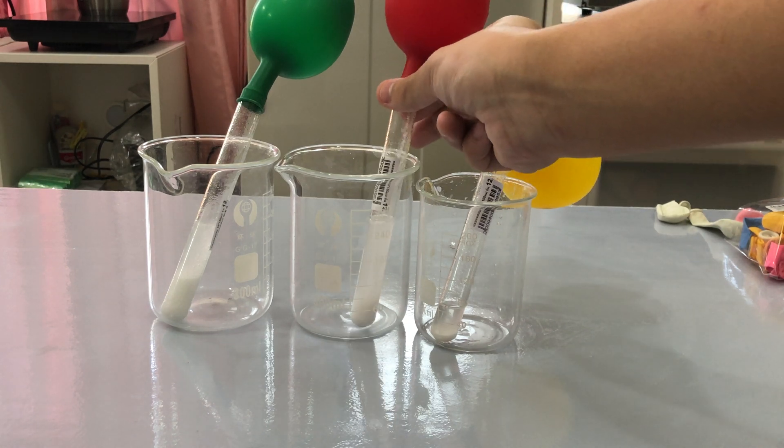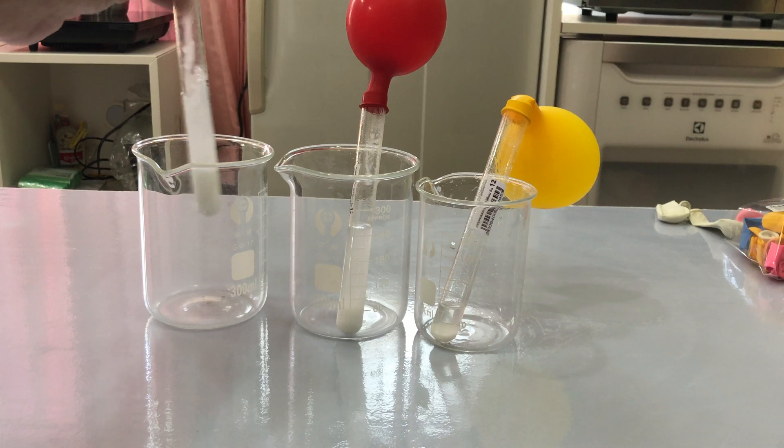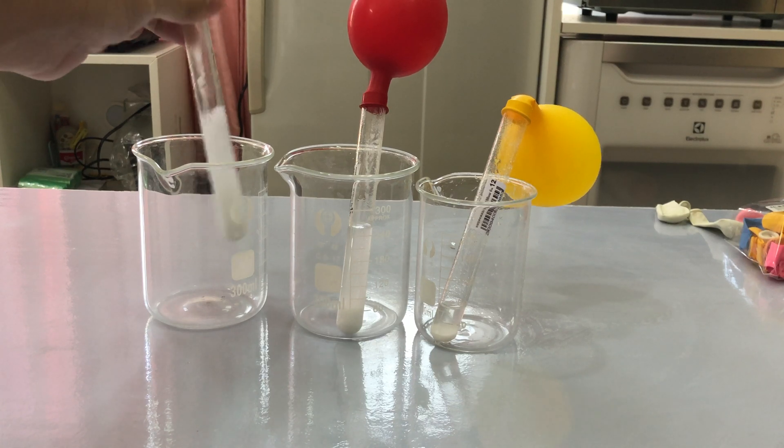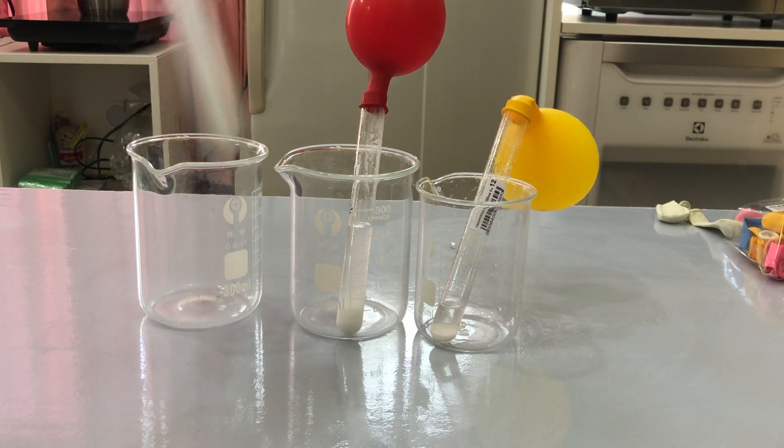The gas inside the balloons has different amounts because we used different amounts of sodium bicarbonate that reacted with the acetic acid, making different amounts of carbon dioxide in each balloon.